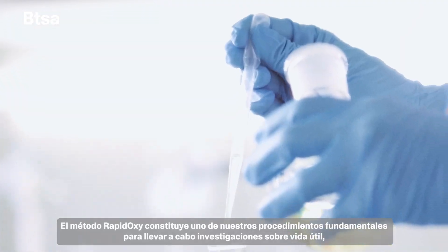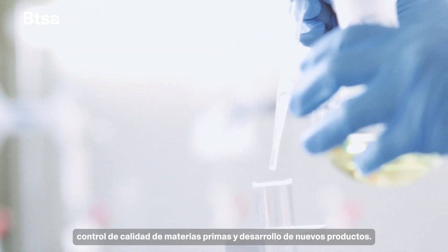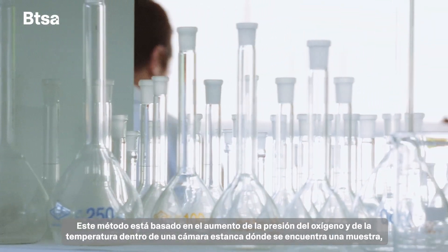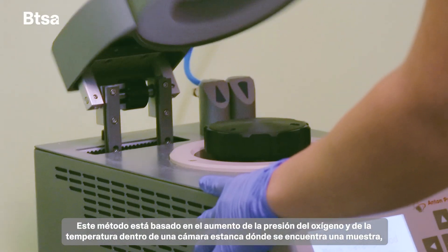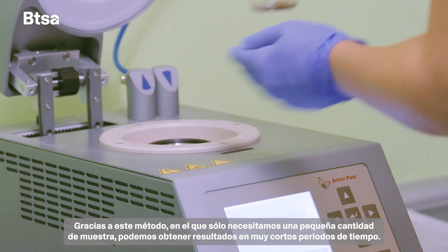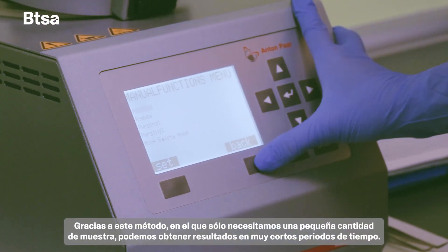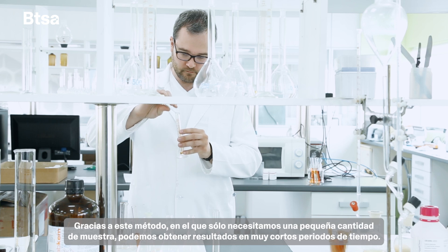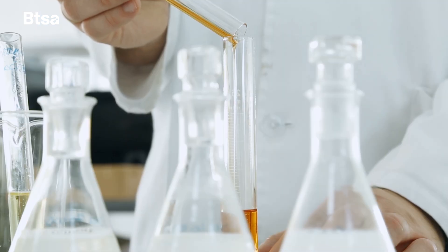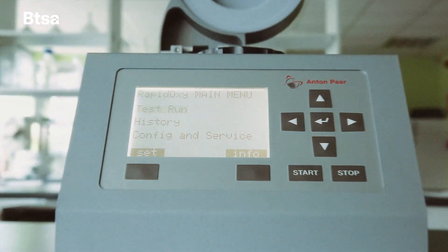The rapidoxy method is one of our fundamental procedures to carry out shelf life investigations, quality control of raw materials, and new product development. This method is based on the increase in oxygen pressure and temperature within a sealed chamber where the sample is located. Thanks to this method, in which we only need a very small sample, we can obtain results in very short periods of time.